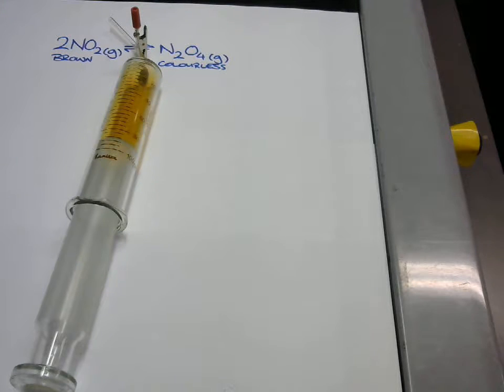Then I'm going to reduce the pressure, pull on the syringe. And because it's clamped at the end, that is not going to change the number of particles in there, just the pressure. And that's also going to have an effect immediately as the particles spread out. But then the second observation, the one you put in the exam answer, is what then happens to the concentration of these 2 gases.